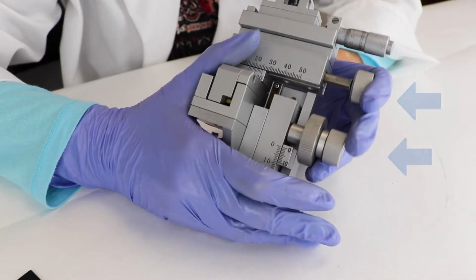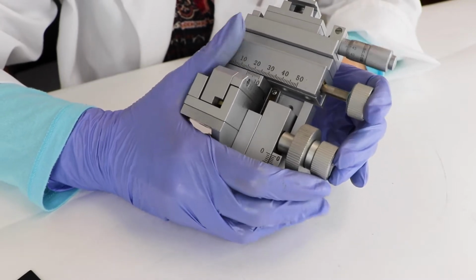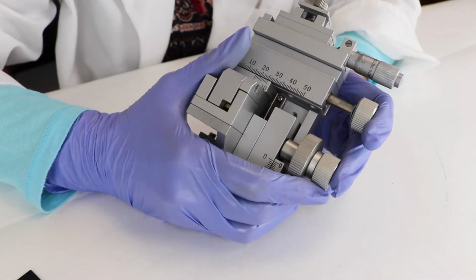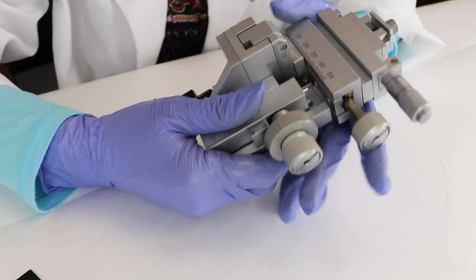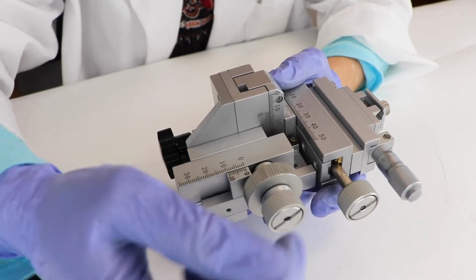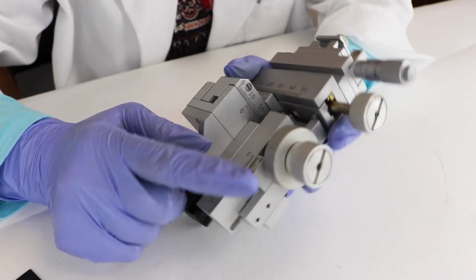And each of these coarse axis controls on the micromanipulator have their own adjustments. So this procedure is very similar to the one we used for adjusting an M3301. It also works very similar on an MD4 or an MMJ. So when we're looking at this, here's your x-axis control, here's your y-axis coarse control, and this one right here is your z-axis coarse control.